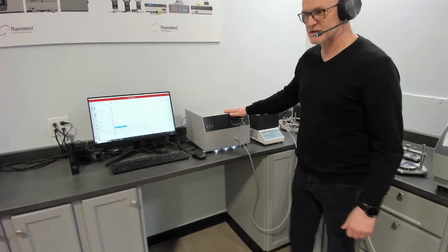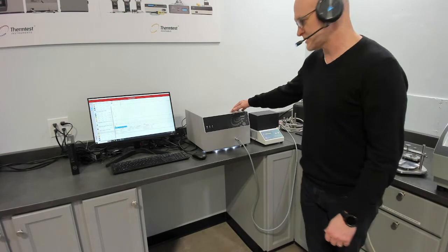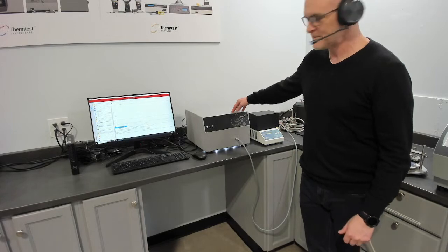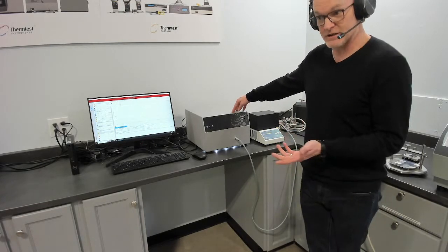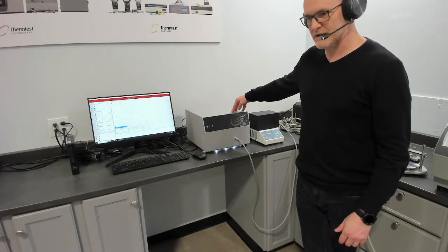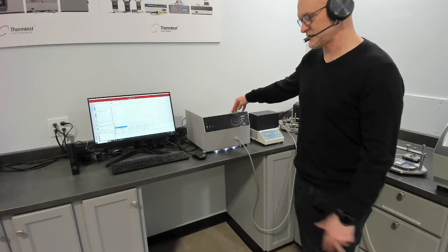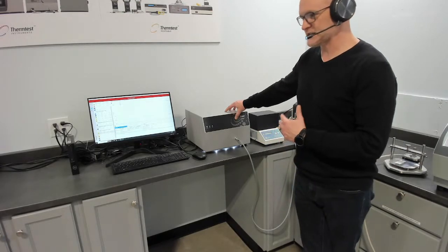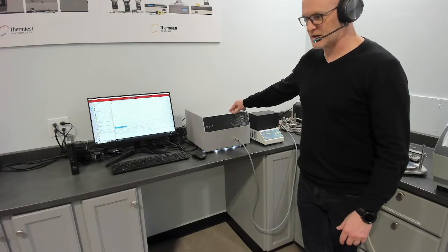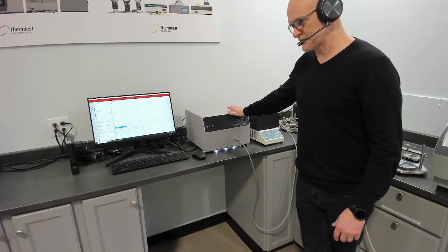This is our new addition to the MP family, measurement platform family. MPV standing for versatility. This combines transient plane source for solids, pastes, and powders according to ISO 22007-2. That would be the transient plane source method, as well as the transient hot wire method. Following ASTM 7896 for thermal conductivity, thermal diffusivity, and specific heat on solids and phase change materials. So we brought this together as a mid-range offering of the measurement platform due to customers' interest in a mid-range instrument. So we'll be doing some demonstrations on that next week.